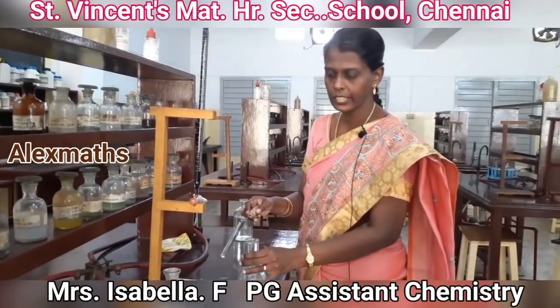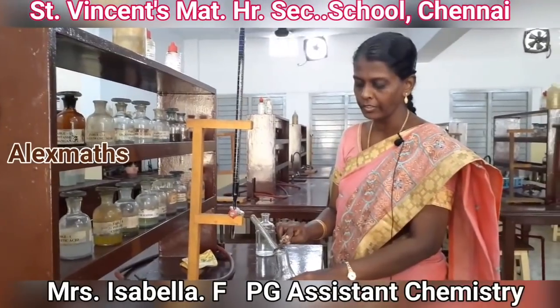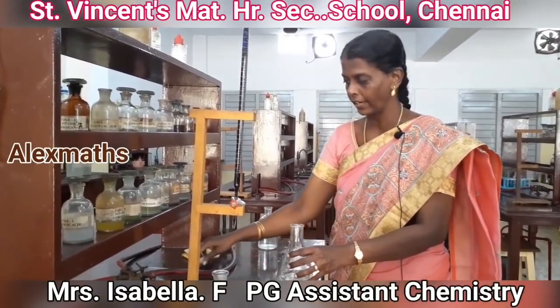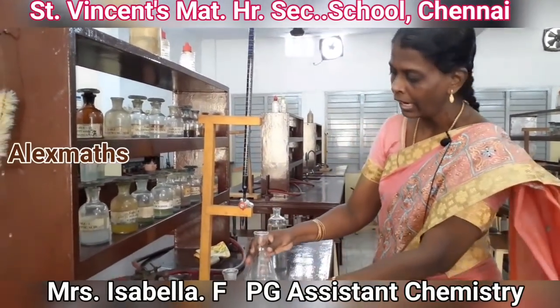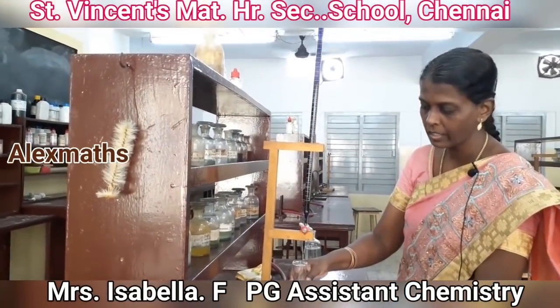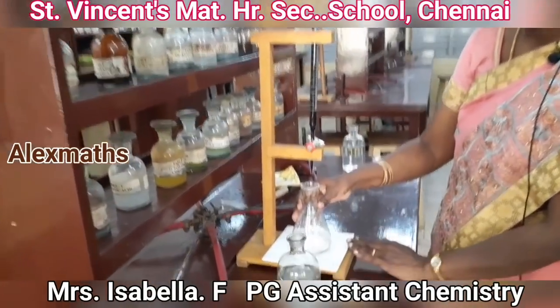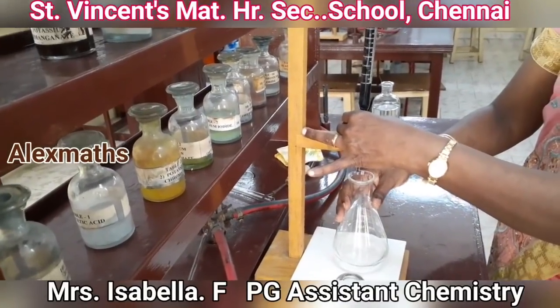As the reaction is done in the acid medium, we add a test tube full of sulfuric acid, whose normality is 2N. It is a dilute solution of sulfuric acid. Now keep the conical flask under the burette. There is a white tile which is present here such that the color changes can be seen properly, and the tap of the burette is slowly opened.